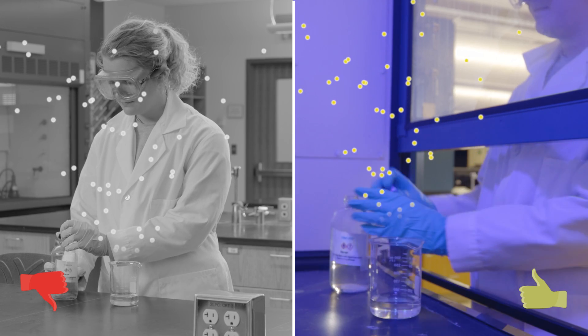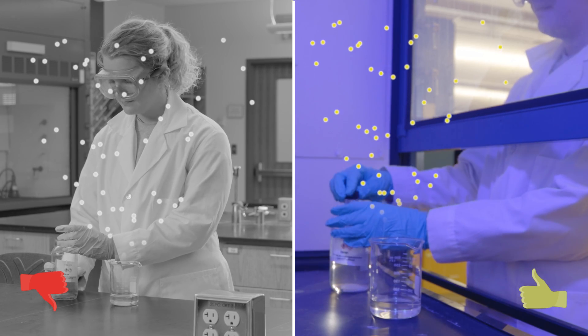We'll dig deeper into assessing risk in another video, but for now, just remember all experiments pose some risk, and most experiments can be done safely if the risk is reduced to acceptable levels.